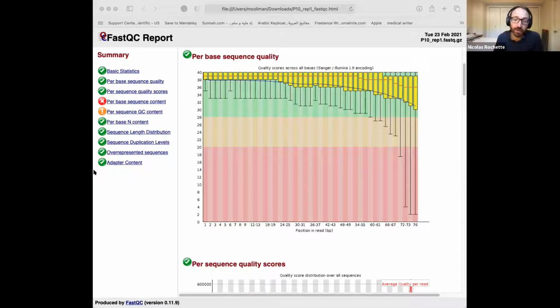Although at the very end of reads, we do see this drop of quality, because Illumina is a sequencing by synthesis technology, like Sanger. So we have the same phenomenon where the further into the read you are, the worse the quality gets.